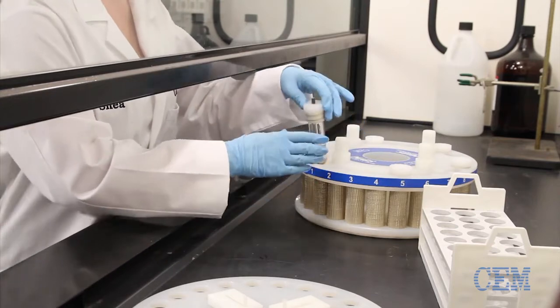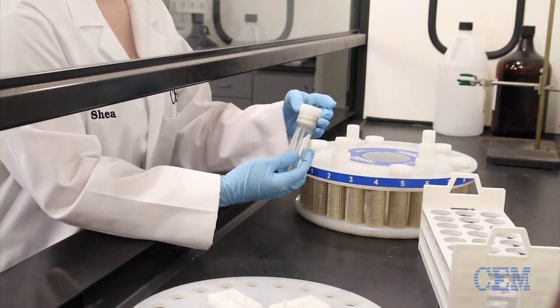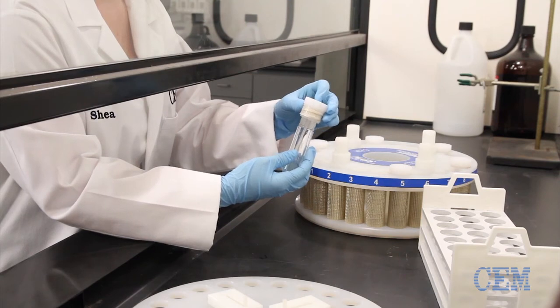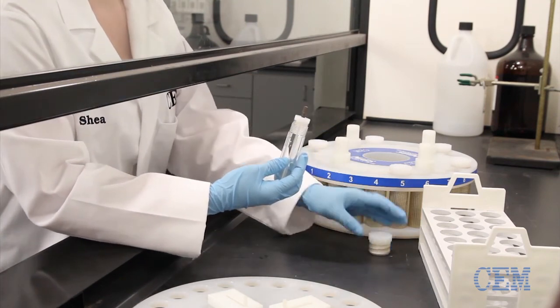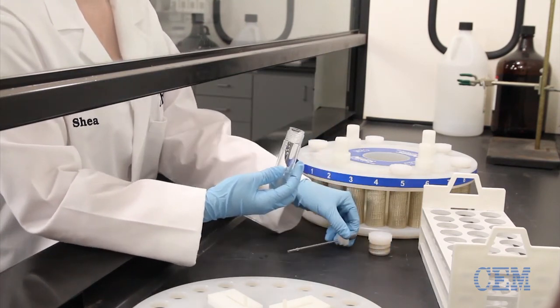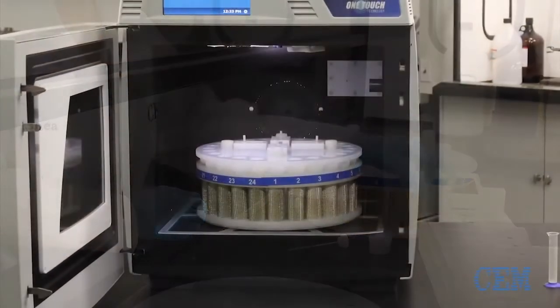Open each vessel slowly, pointing the top toward the back of the fume hood. Be sure not to loosen the vessel top too quickly or rapidly escaping gases may cause injury. After the vessels have been opened, you're ready to perform the reaction workup.